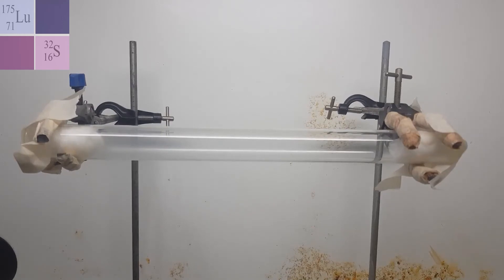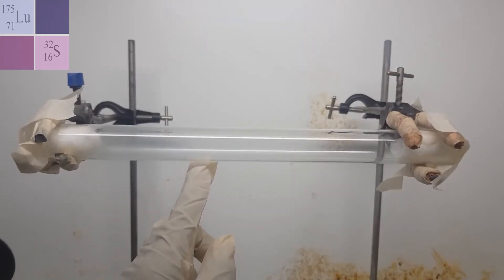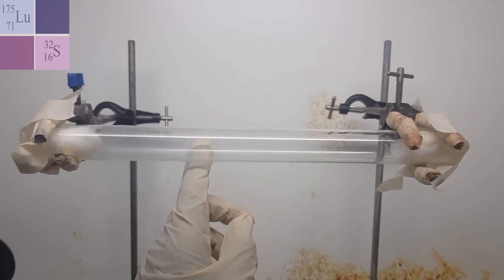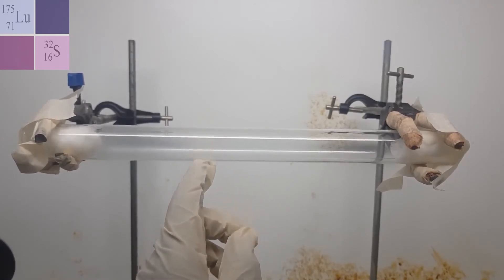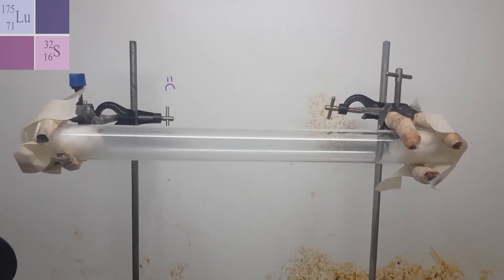Now it's kind of hard to see with this setup but I'm seeing that up until here it has a lot of cloudiness while the rest of here was clear. Now it's honestly cloudy and it's spreading throughout here. So I don't think I'll get my clearly defined ring so I'll use this marker here as the point where they would have met. So I'll have to use that because I'm not getting the white ring that I was expecting. I think maybe my HCl and my ammonia probably need to be more concentrated.